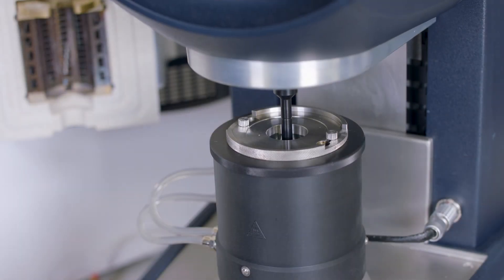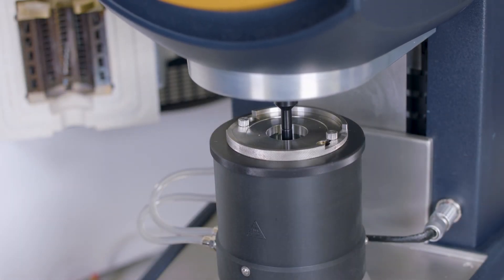Now with the fixture mounted and calibrated and the sample loaded, the operator can start the programmed experiment.